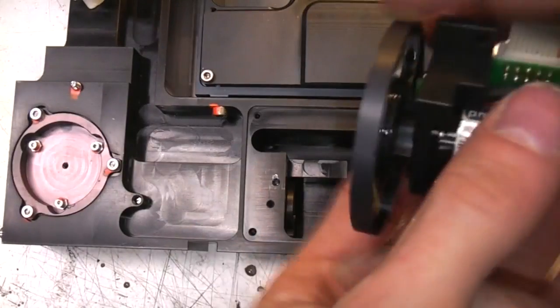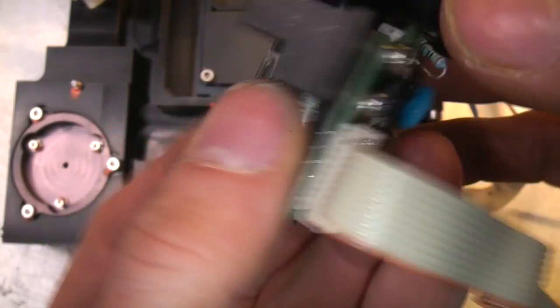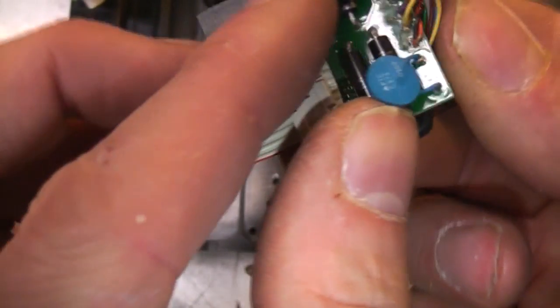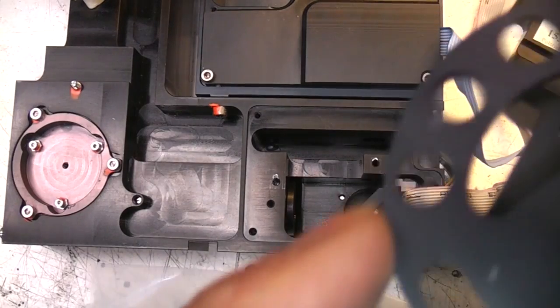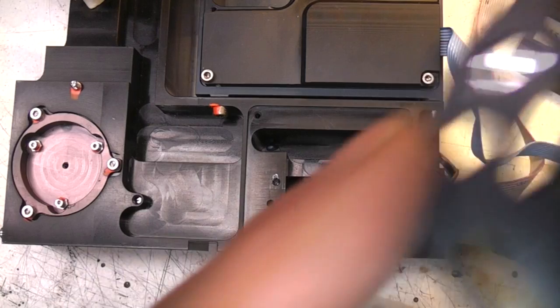Rotate it, it rotates the wheel, so that's selecting a particular polarization. It's a nice little motor, I think that's probably a stepper, and you can see there's an interrupter to get a zero reference there, and just a little board with some diodes and PTC protection on it. And there's also positions for some other filters, of which there is one filter fitted.